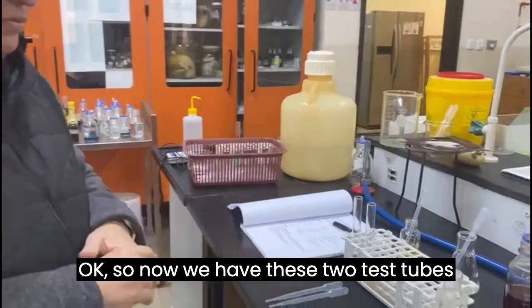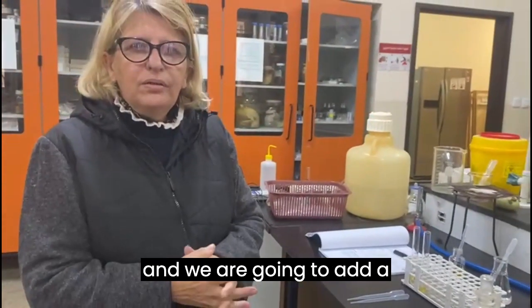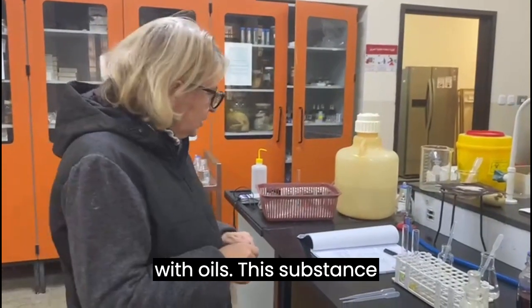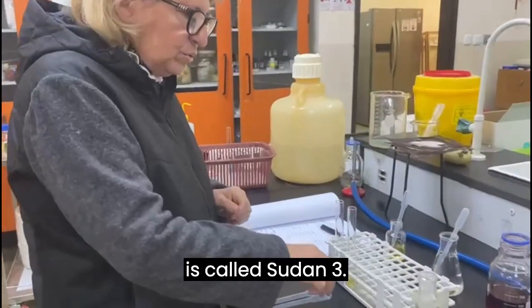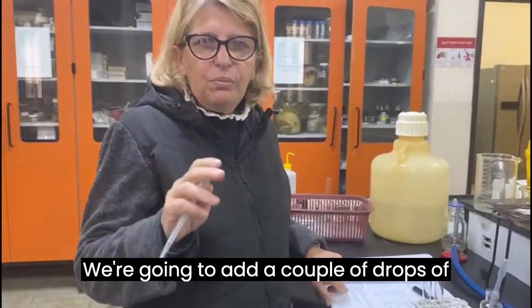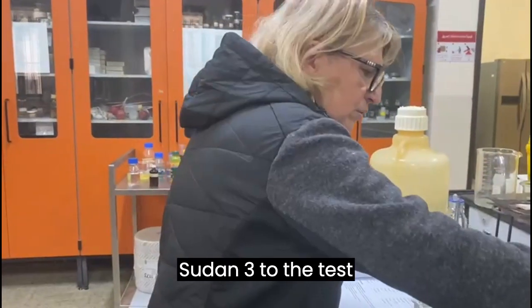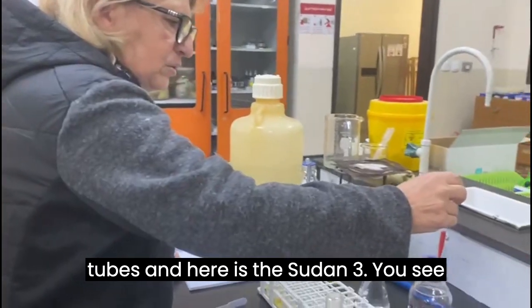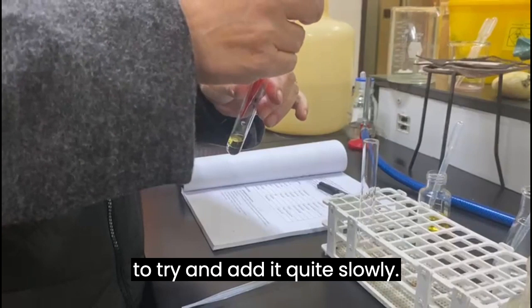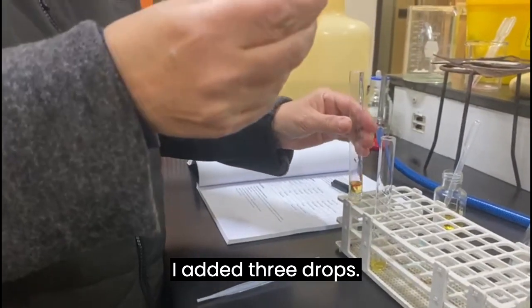Okay, so now we have these two test tubes, and we are going to add a substance that mixes with oils. This substance is called Sudan 3. We're going to add a couple of drops of Sudan 3 to the test tubes. Here is the Sudan 3, you see the color is red. And again, I'm going to try and add it quite slowly. I added 3 drops.